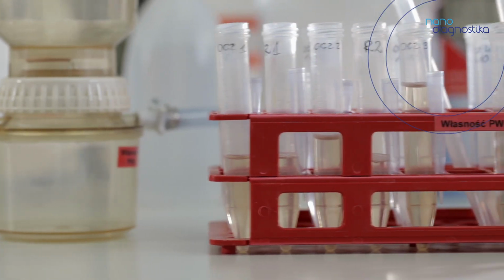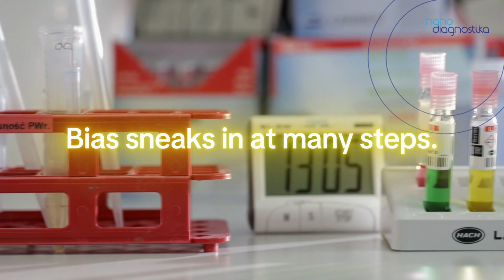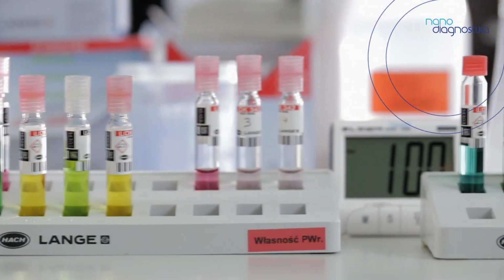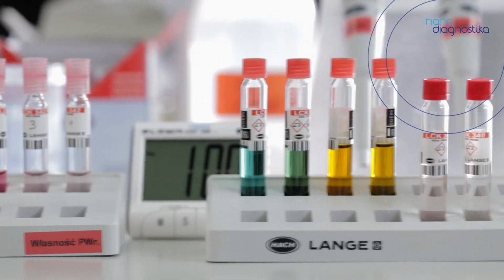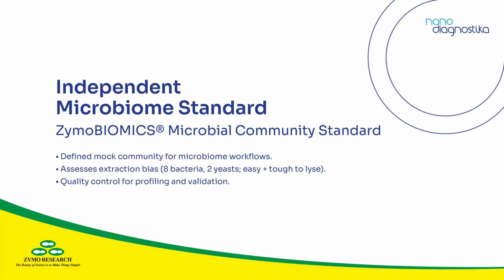Microbiome work lives and dies on controls. Bias can slip in during lysis, DNA extraction, PCR setup, on the sequencer, or later in the pipeline. Without a reference, it's hard to tell if your community profile reflects the sample or your method. That's where the standard helps. It gives you an outside yardstick so bias becomes visible and fixable.